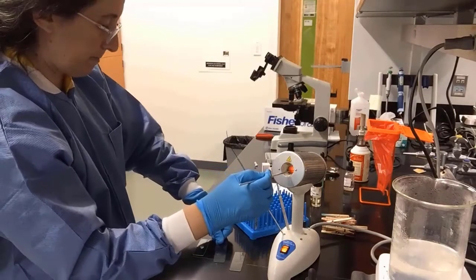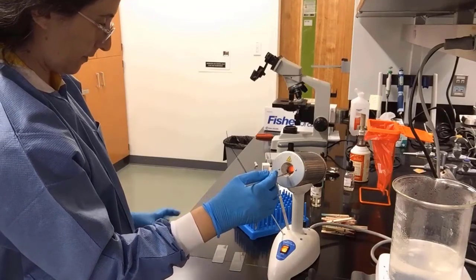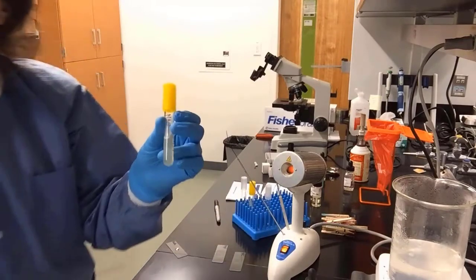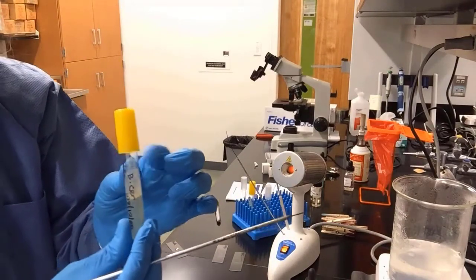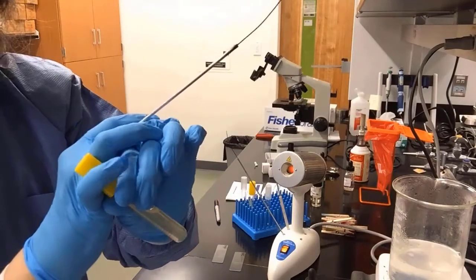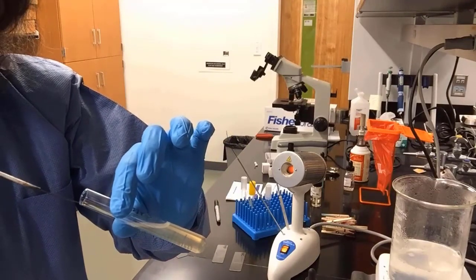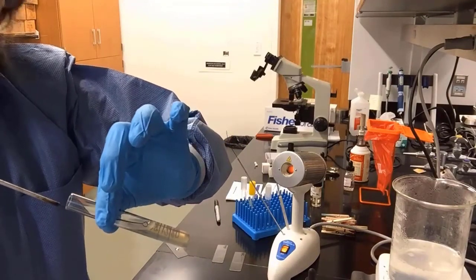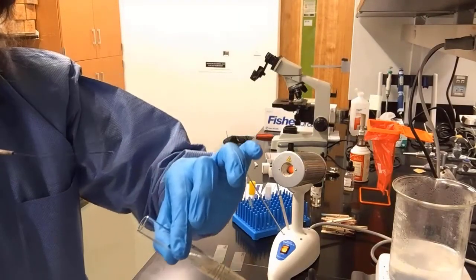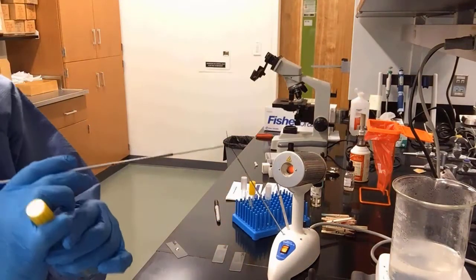We will sterilize our loop. And now we will create our smear for bacillus on the bacillus slide. Here's bacillus. You can see the film growing on the slant. We will use our ring finger and our pinky to prevent the cap from touching anything and getting contaminated. We will go in and barely scrape off some of the slime, the bacterial slime, off of the surface of the slant.